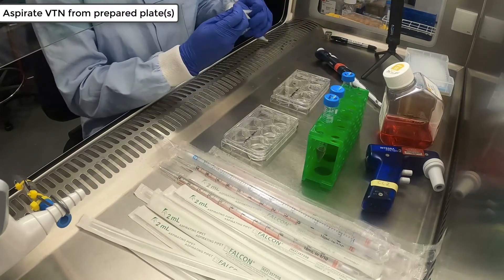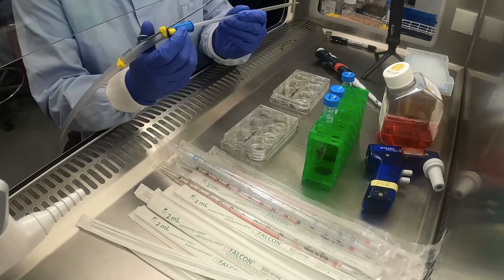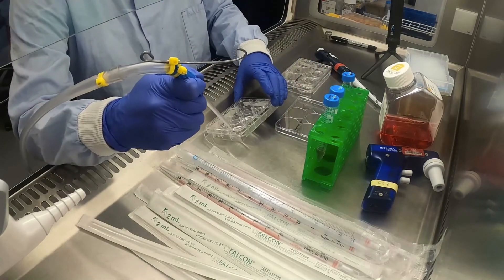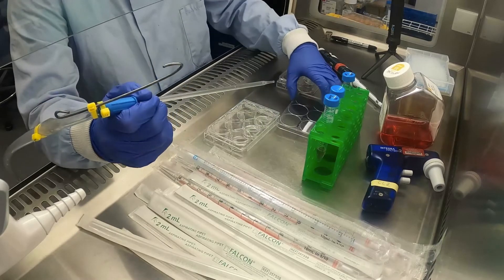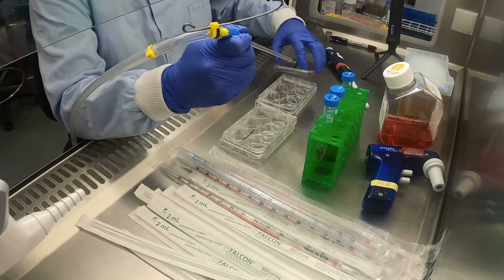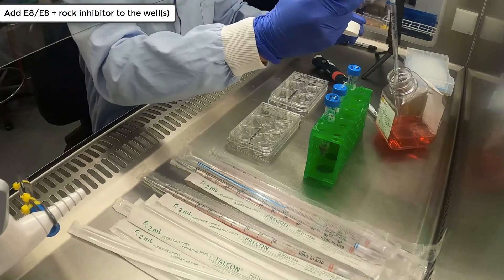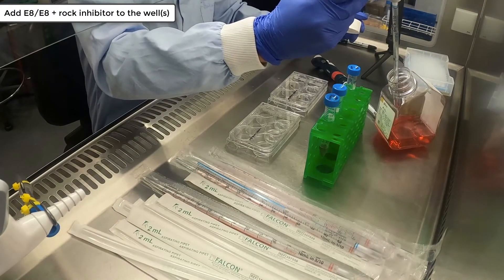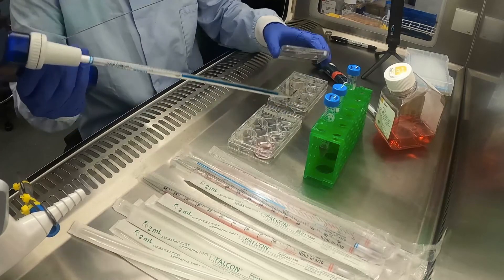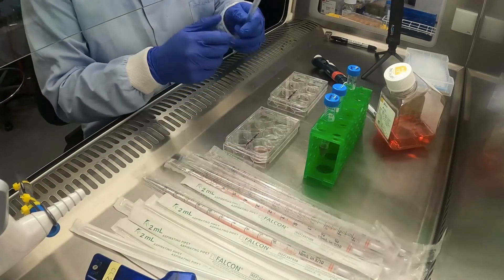Get your new vitronectin-coated 6-well plates and aspirate the vitronectin from the surface. From the cell count, we have calculated that we need 500 microlitres of the E8 cell suspension in order to seed 150,000 cells per well. For the E8 plus rock inhibitor suspension, we need 800 microlitres to seed at that same density.